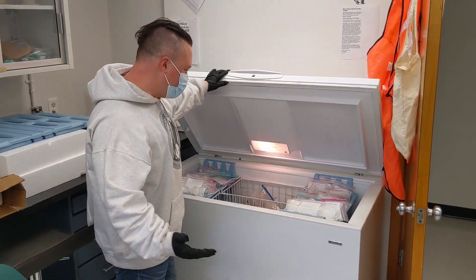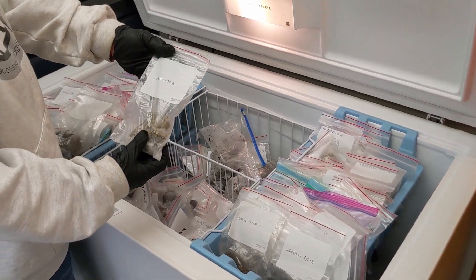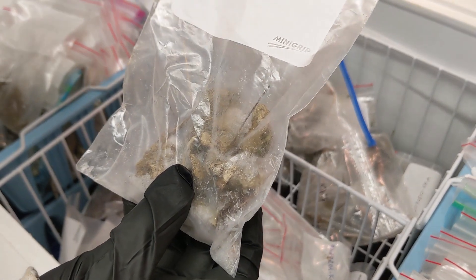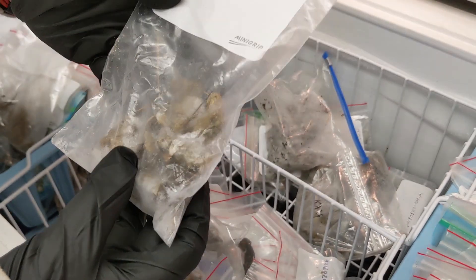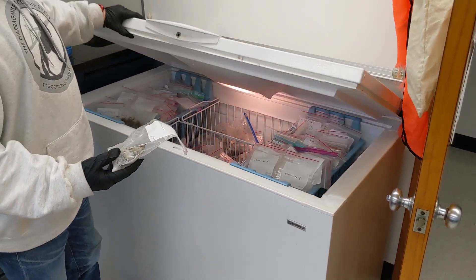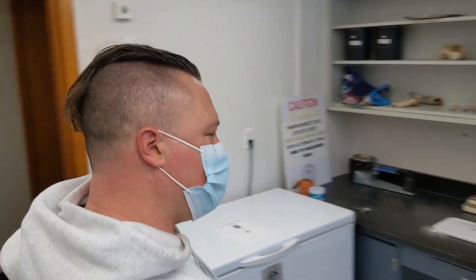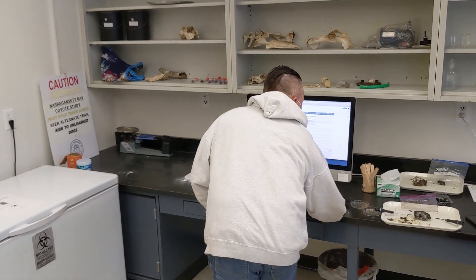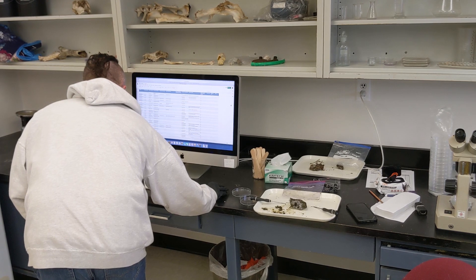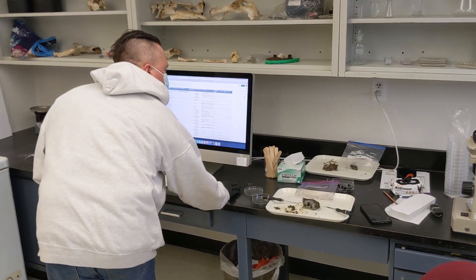When we get our samples from the field, they go in the freezer. We code them with the date, the person who collected them, and the scat for that day. We have over 200 scats now — we have 209 right now. We have them all in the database here.